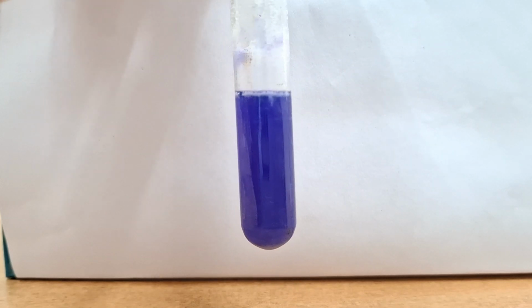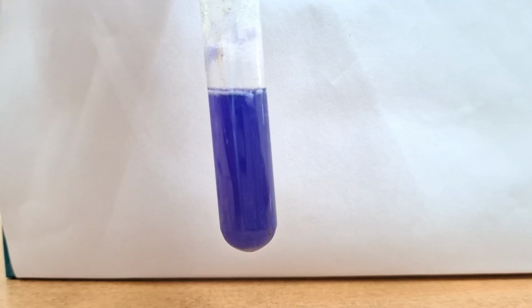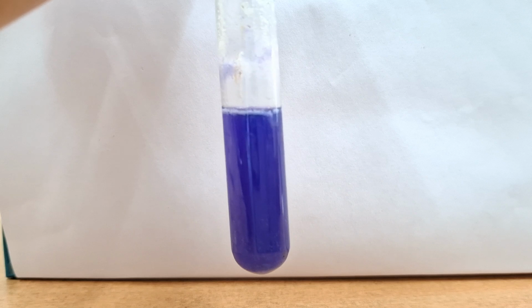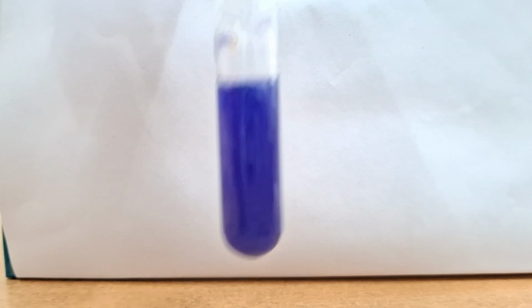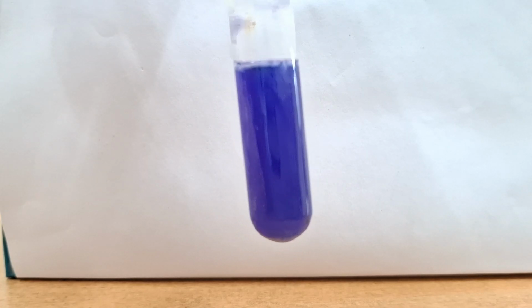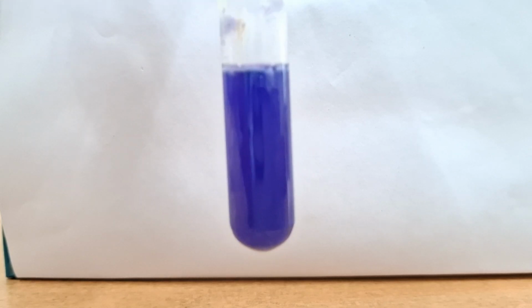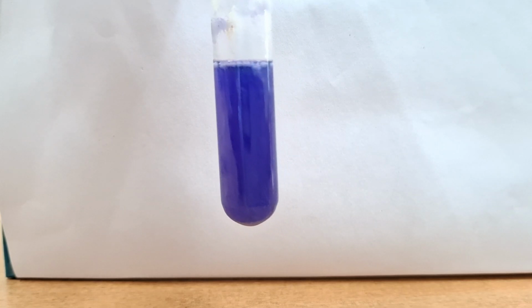On the second hand, you can see this test. This is a ninhydrin test. How will you perform this test? You have to take 2 ml of the protein solution given to you, and add 4 drops of 1% ninhydrin solution. Mix it and boil it for 1 minute, and it will result in a dark lavender color, which indicates free alpha amino acids are present. This test indicates free alpha amino acids are present. Okay, so this is the ninhydrin test.